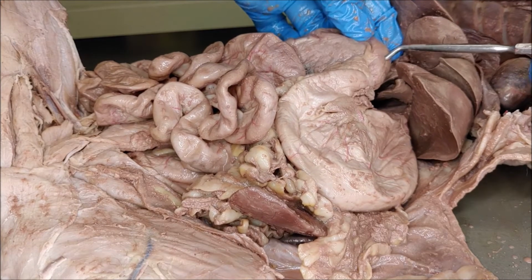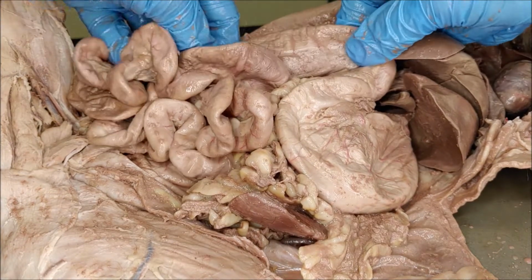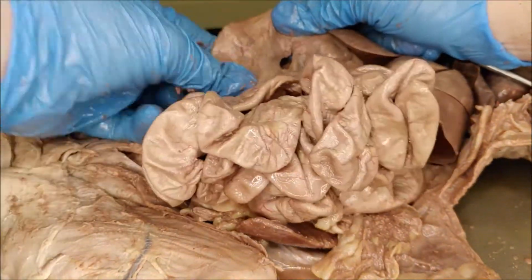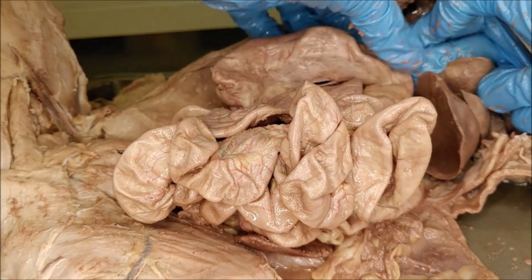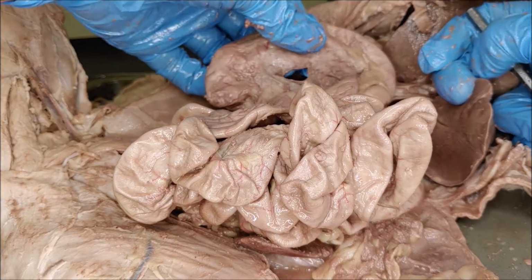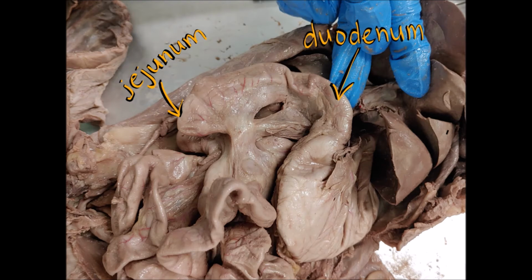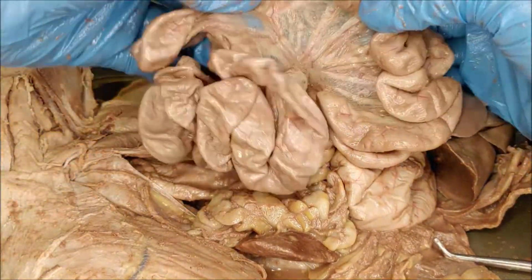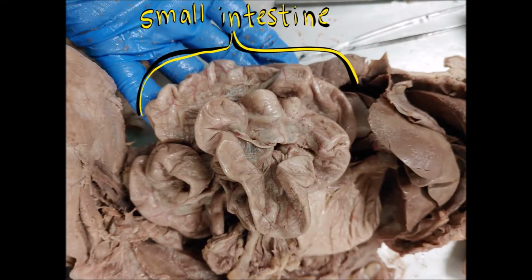the small intestine. The first part of the small intestine here is called the duodenum, and it will continue until we reach this sort of sharp curve right here, and that's where the jejunum begins. So once again, right after the stomach, you're going to find the duodenum, and then this first curve right here is the beginning of the jejunum. The jejunum actually makes up most of the length of the small intestine. The small intestine is longer than the large intestine, but it's smaller in diameter.